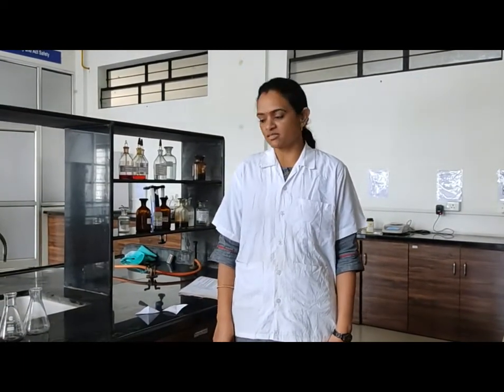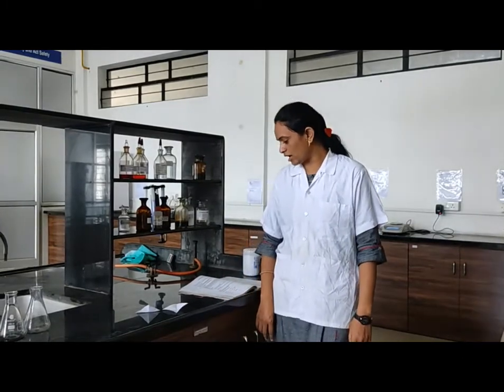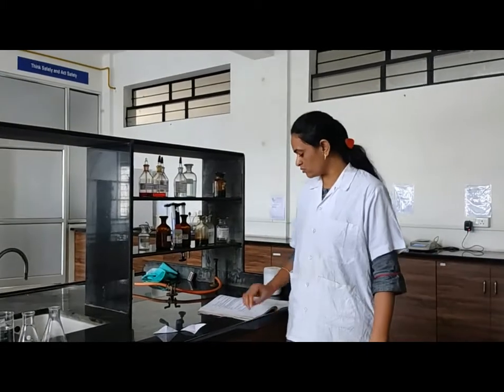Hello friends, welcome to pharmaceutical chemistry laboratory. Today we are going to perform assay experiment number nine, assay of boric acid. In the previous session we already discussed the concept, principle, reaction, factor, and apparatus required for the actual practical procedure. Let's start with the practical.